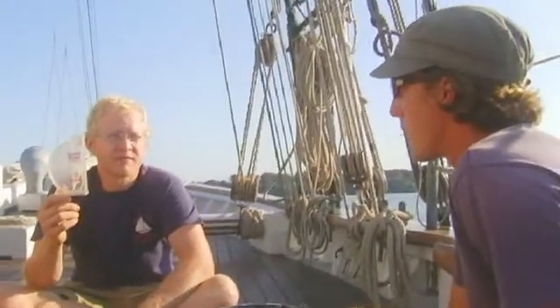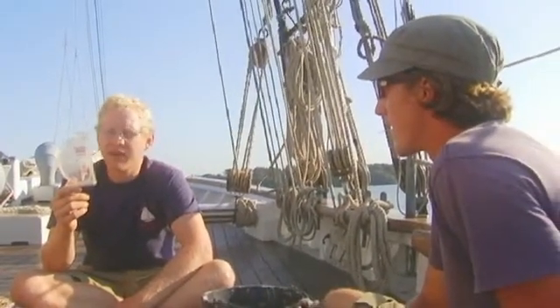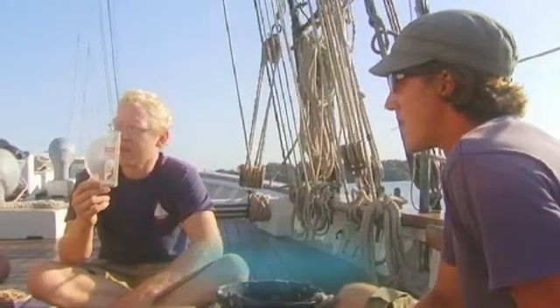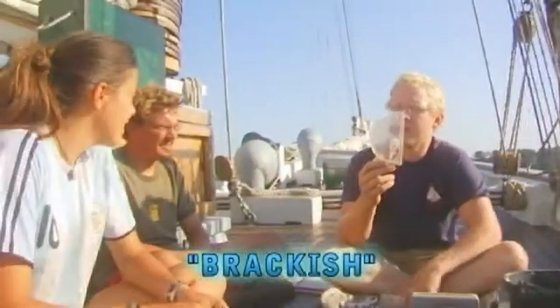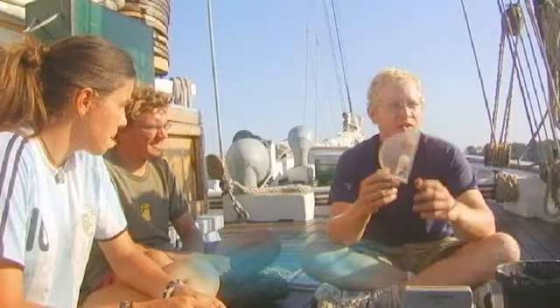Students predict zero and ten. Why ten? Because someone told me the water here is brackish. Do you guys know what brackish means? Salty and fresh. Let's test it and find out — can you dunk that under?